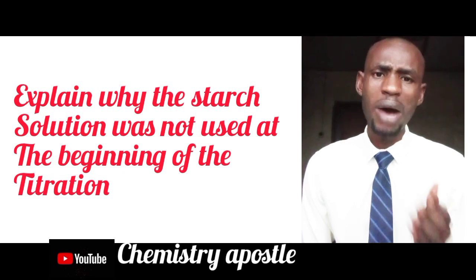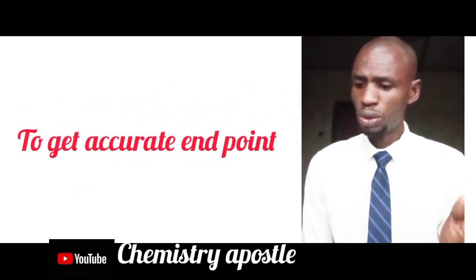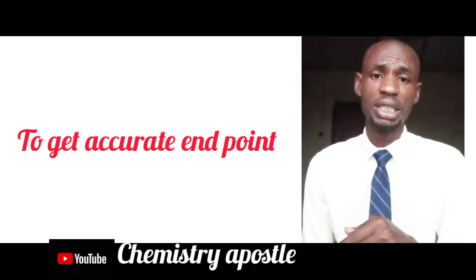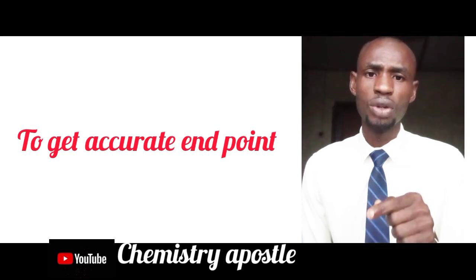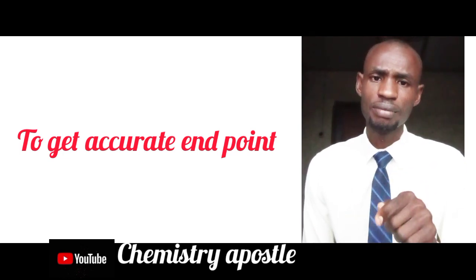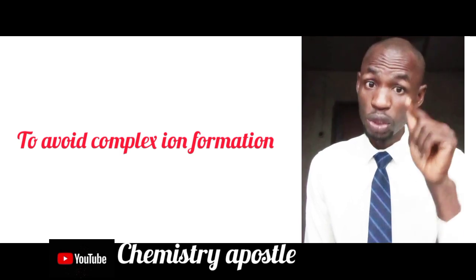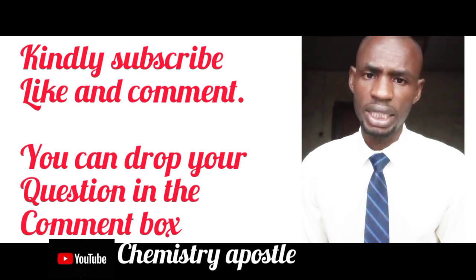There is a question from some years ago: why do we not use starch at the beginning of this titration? The answer is, first, to get an accurate end point. We do not add starch at the beginning of this redox reaction in order to get an accurate end point. In conventional acid-base reactions, we use the indicator before the commencement of titration, but here we do not. Another reason is that there will be a complex ion formation if we use starch at the beginning of the reaction, and that will affect the end point we obtain.